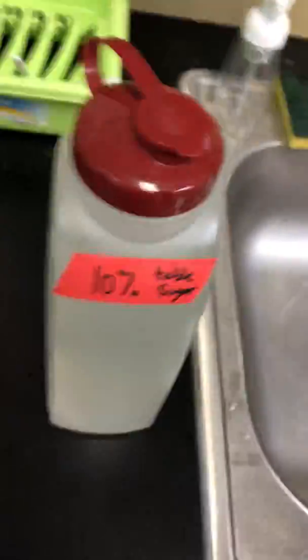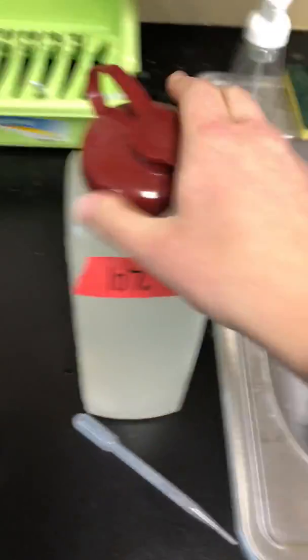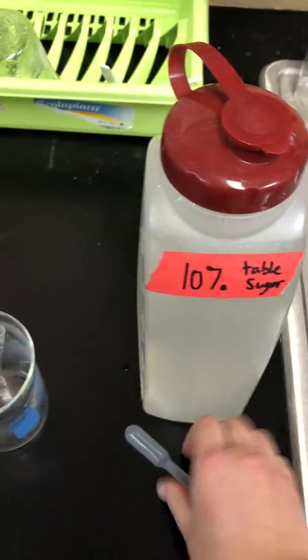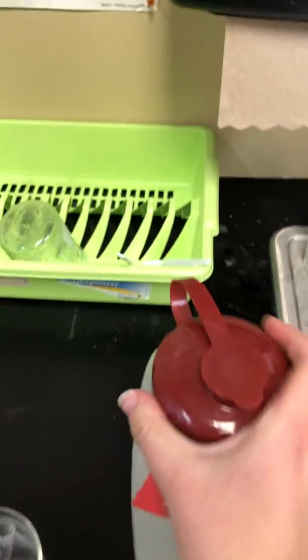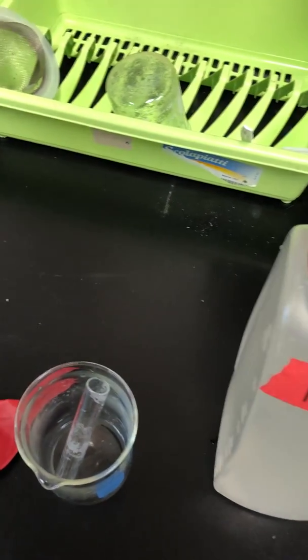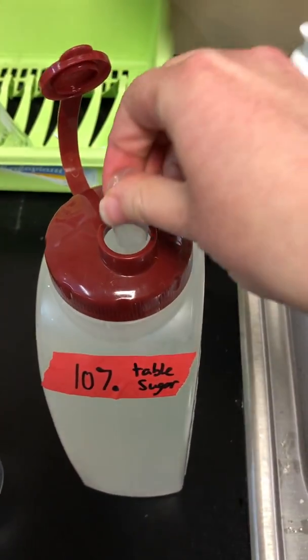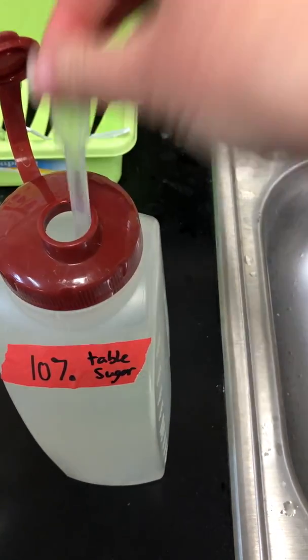So pretend like I've shaken up the sugar. I'm gonna take it over here to the sink, because if I'm messing with liquids, I probably want to be at the sink. We're going to take off the lid and pipette out 6 milliliters. So let me do that really quick. All right, I guess since it's at the top, we don't need to take it out, but we can take off the lid for the class. So we need 6 milliliters total.